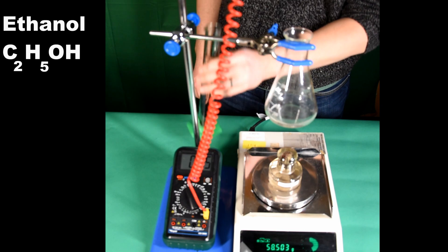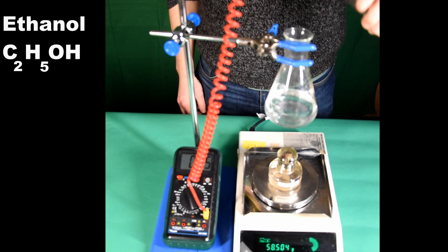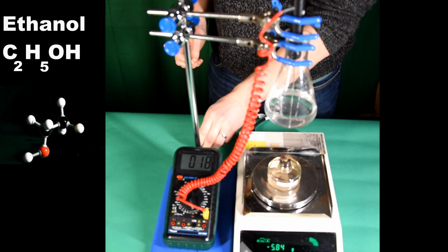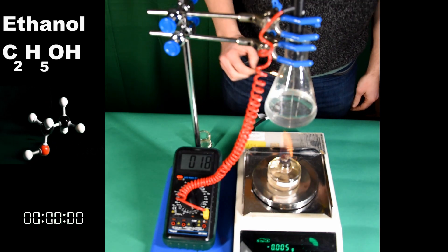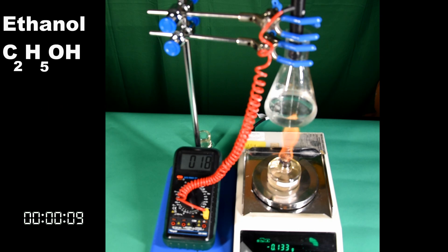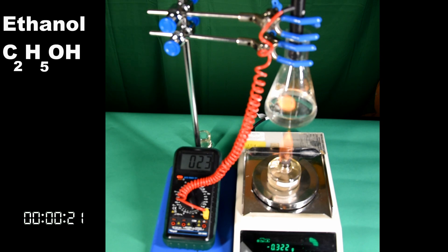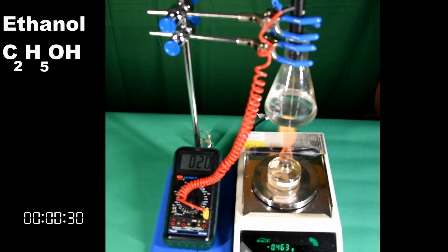The process is repeated for ethanol. The height of the conical flask above the burner is kept constant, and we have tried to keep the same flame size. The time is recorded in the bottom left hand corner of the screen, because the exam board talks about burning for the same time, but we have chosen to burn the same mass of alcohol. This is possible because we're using a high resolution balance, which wouldn't be available for class sets.